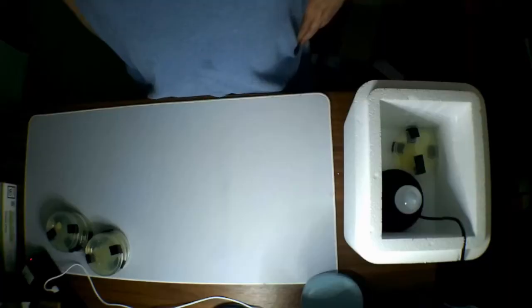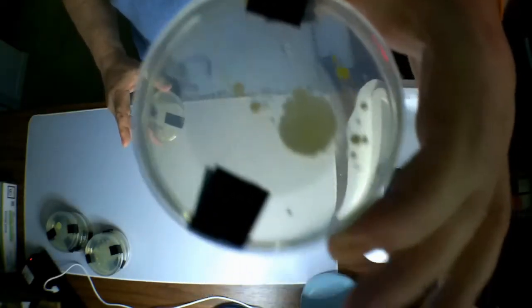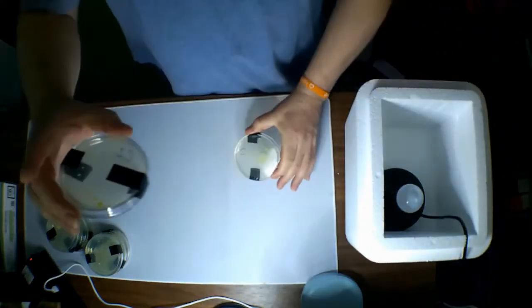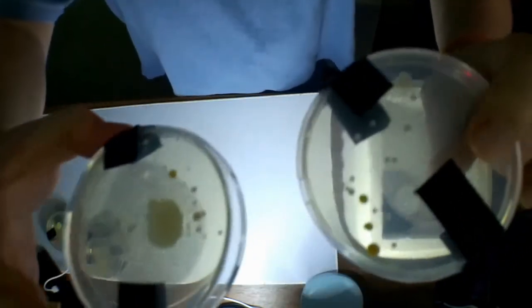This is the big one. Because this was actually designed for being used with a cell phone, this is the one we're most concerned about. And we know for a fact that cell phones are nasty, nasty things. So really worried about this one to see how this is going to result. Let's go ahead and pull it out. Okay, cell phone 1. Lots and lots and lots of bacteria. Cell phone 2. Much less. But still some.